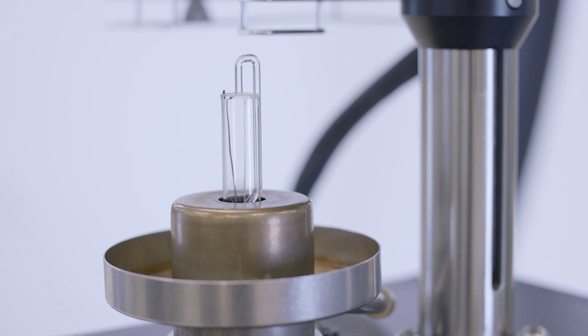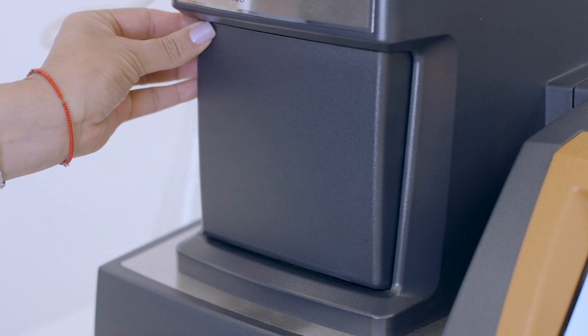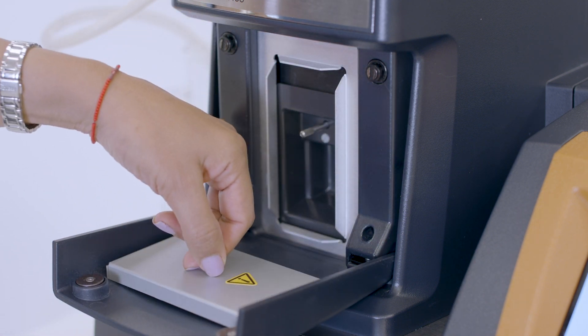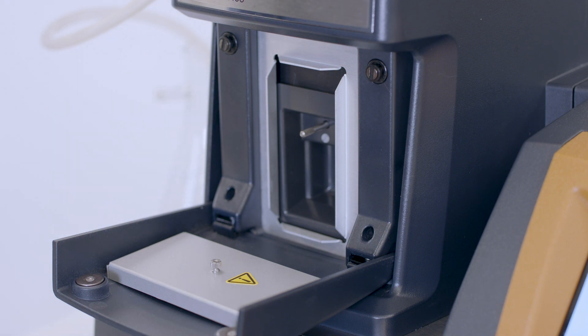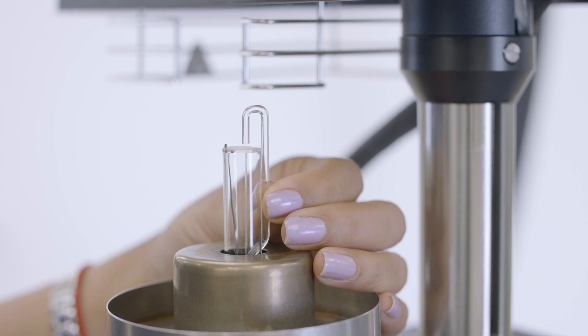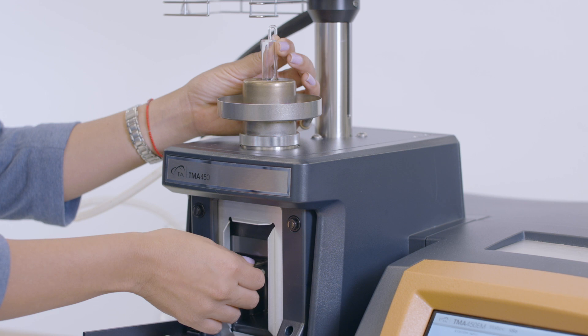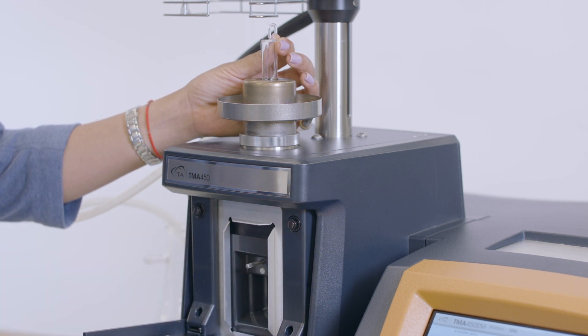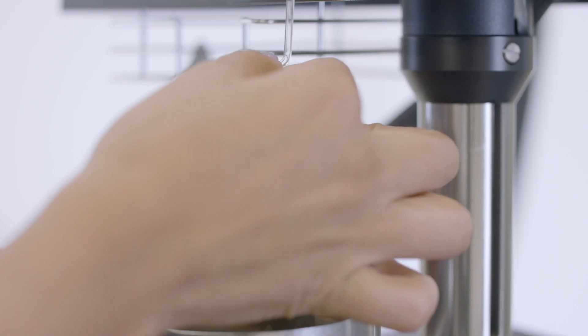The current probe installed is expansion. To remove the probe, press the top of the weight tray door to open. Remove the weight tray shield by pulling the knob straight out. Hold the probe with one hand and with the other hand unscrew the probe locking lever by turning it counterclockwise approximately one turn. Take out the probe carefully.